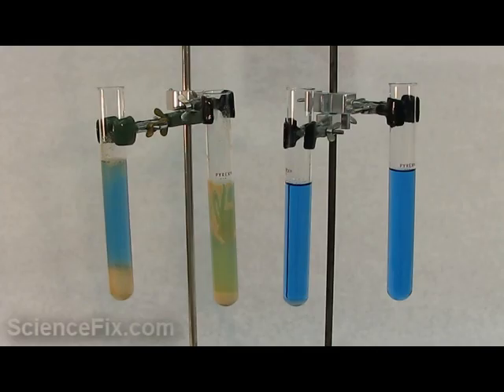There is some leftover sugar from the yeast when it was stored and dried up. But you can see on the far left, the one that had extra sugar added to it is really doing cellular respiration - it's producing carbon dioxide at a much faster rate because it has all that sugar.